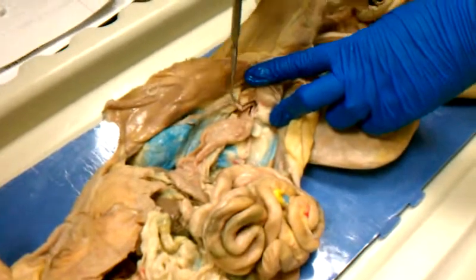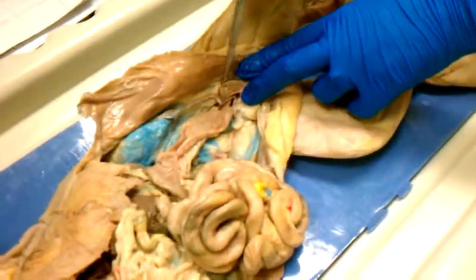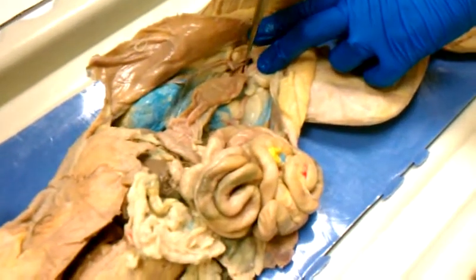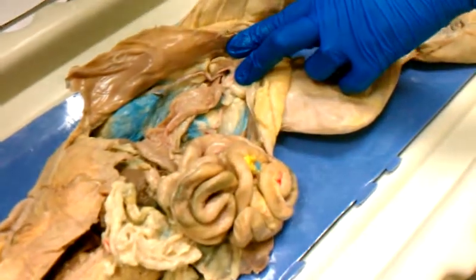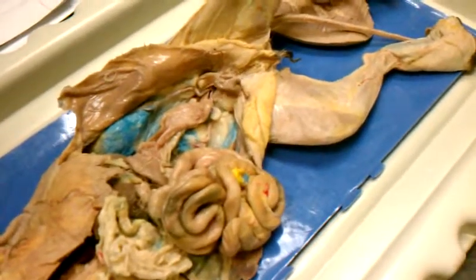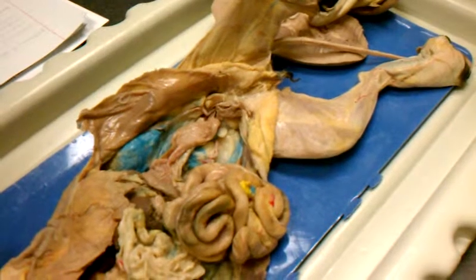So the uterus goes all the way down here, and from this side all the way down here, and these 2 tubes connect. And where they connect, and that single tube that goes down from there, is the vagina in the cat. So it makes like a big Y. So the 2 arms of the Y would be uterus, and the straight part would be the vagina.